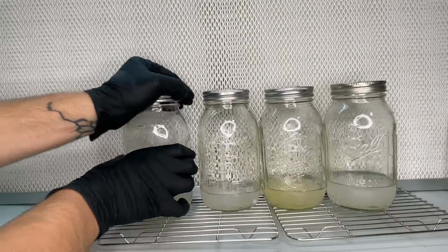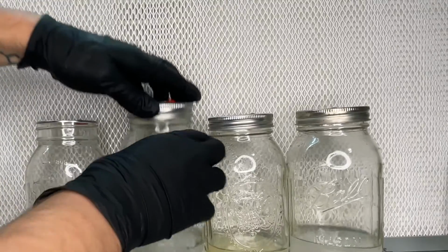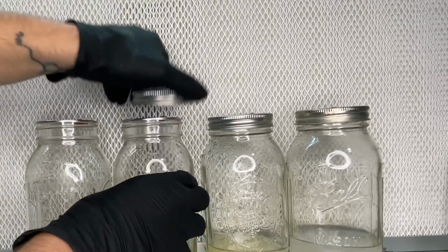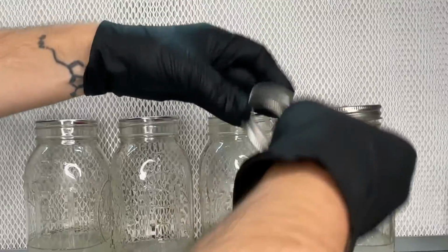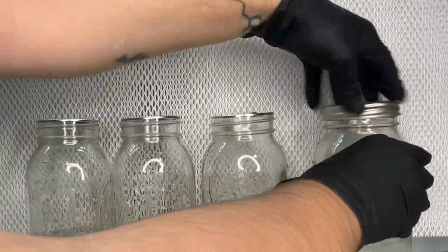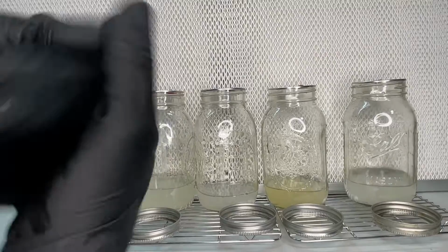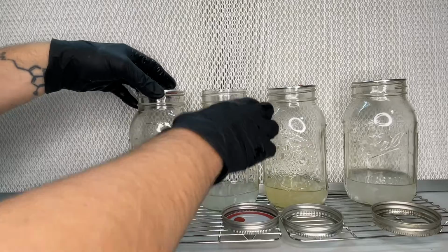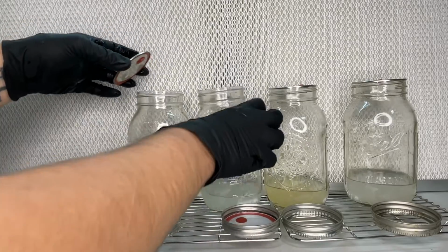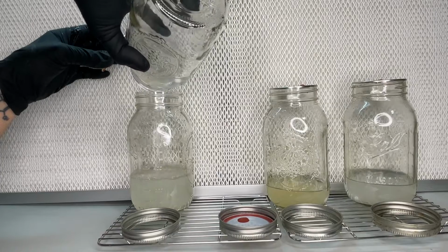The excess liquid can be discarded, and then the leftover mycelium from each of the jars is combined into one jar. Each of the jars contain one magnetic stir bar, so while pouring the mycelium, I also make sure not to dump out the magnetic stir bar and to keep it inside of the original jar.